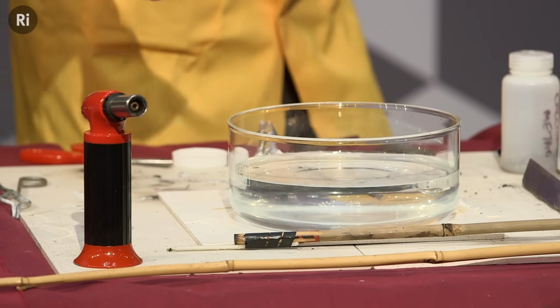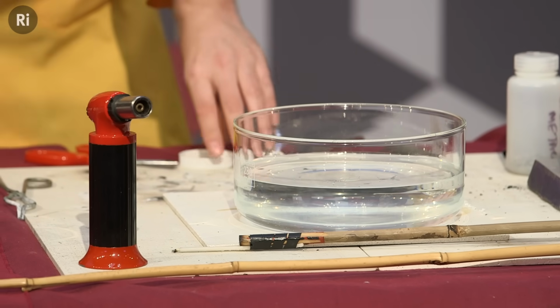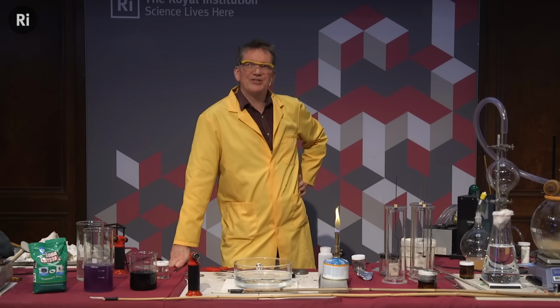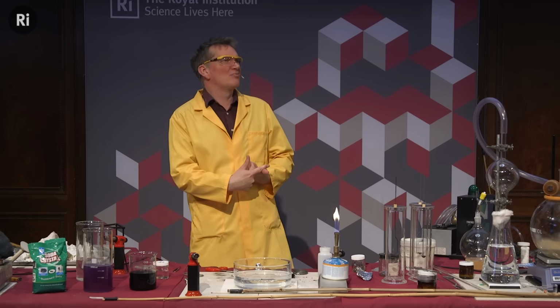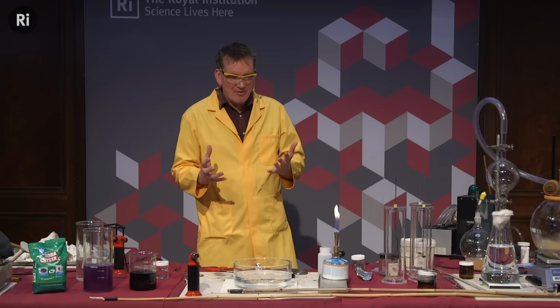I hope. There it is. And it's actually fizzing around on the surface of the water. Oh, there's a little flash of flame there. This is a remarkable substance. I mean, nothing like this had ever been seen before. When Davy first isolated this here, he thought, is this even really a metal? Metals aren't lighter than water. They shouldn't float. They don't react with water like this. This was something that had never been seen before.